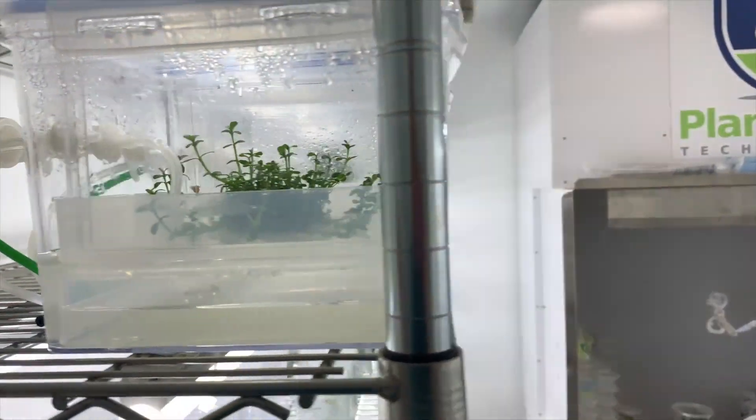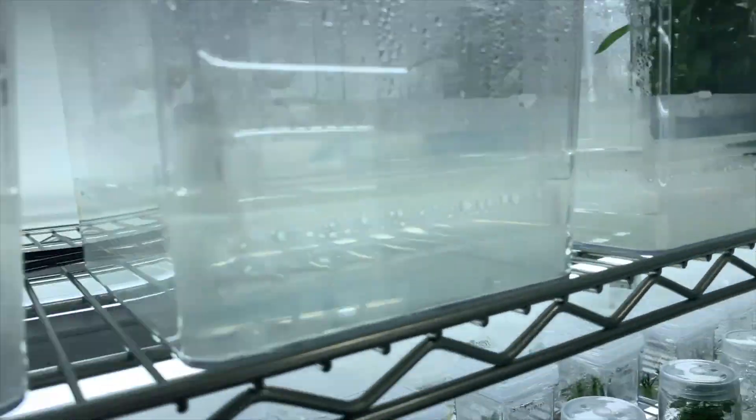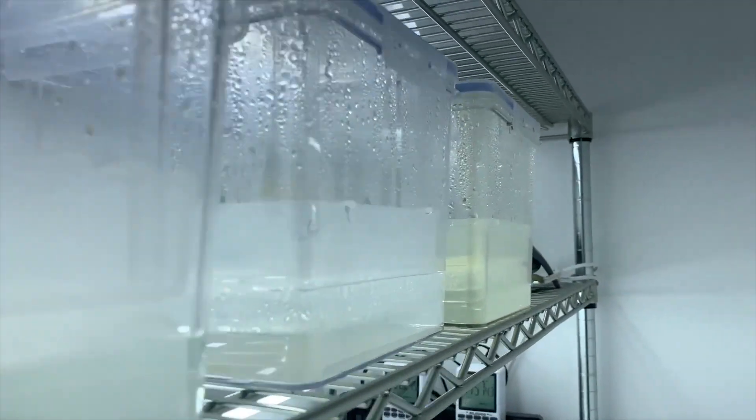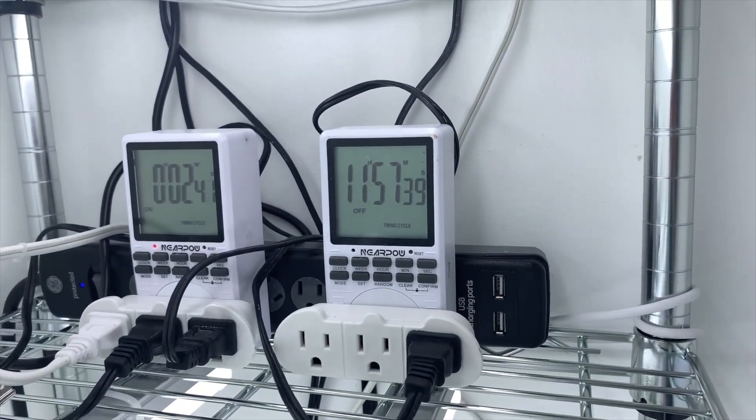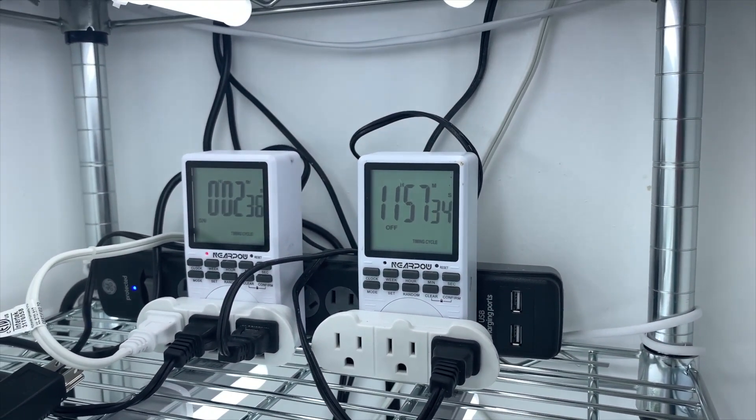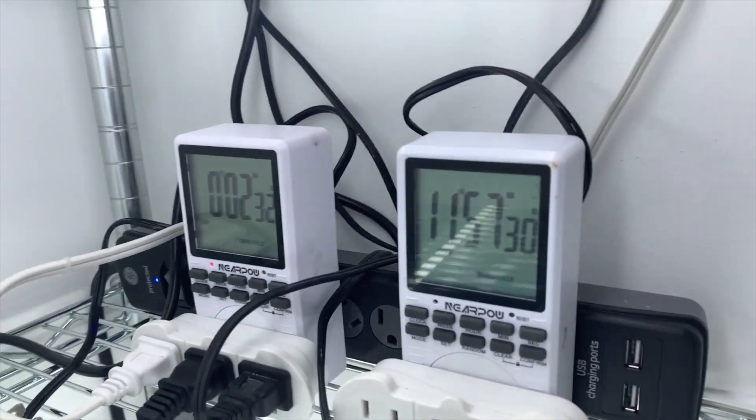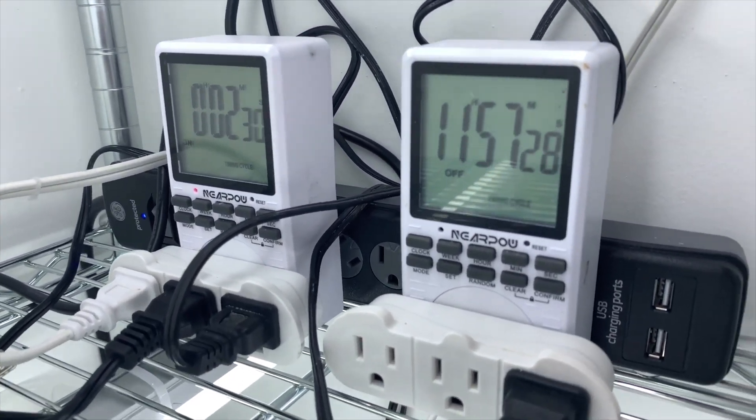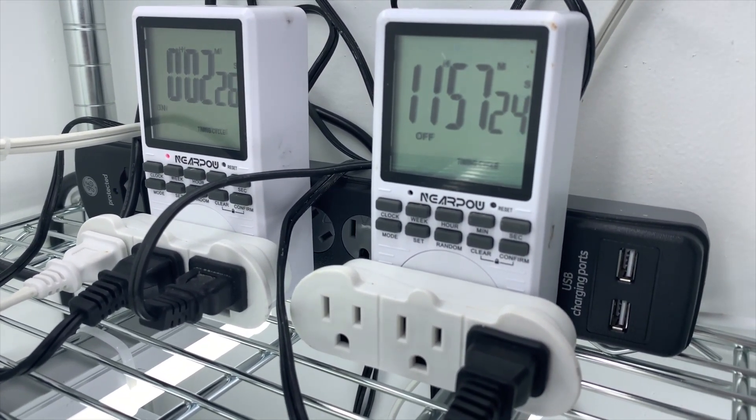So the only thing that is left is that the media has to go down and that will be pretty much everything. And the setup is actually for 12 hours. So this repeats every 12 hours for five minutes. And that's been sufficient for most of these plants. You can do, I know some people do about 30 seconds or one minute soak, and they do more often.